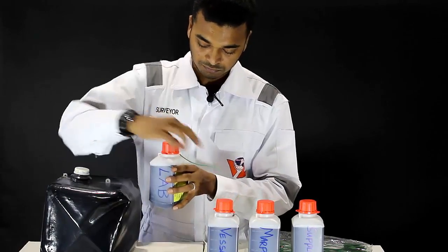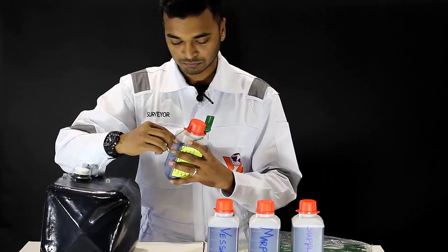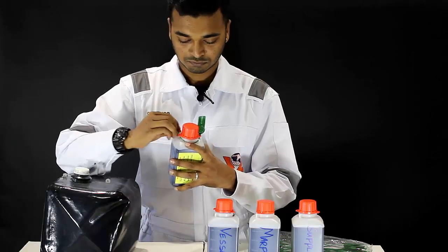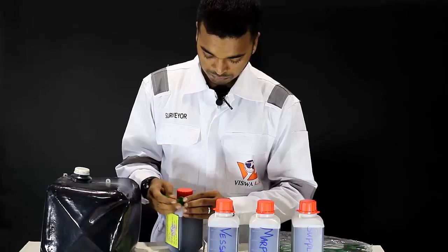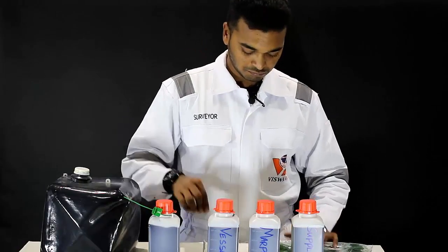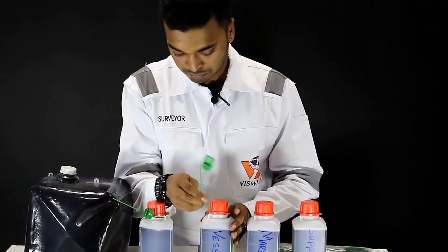Take the provided seals and seal each bottle. Make sure the bottles are well sealed.